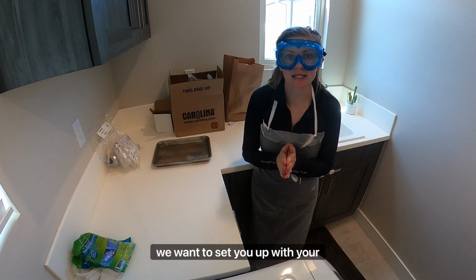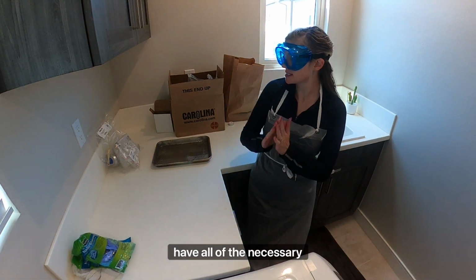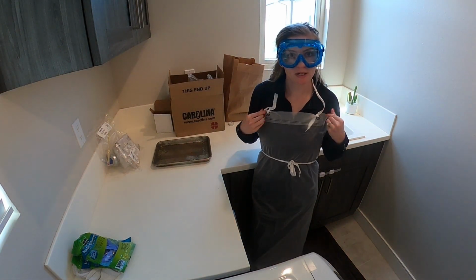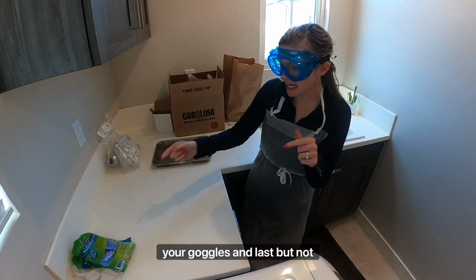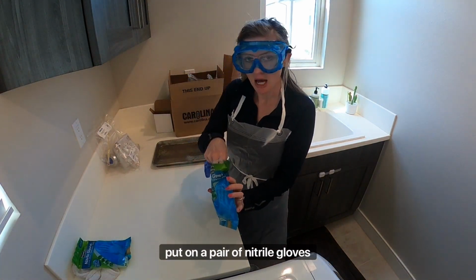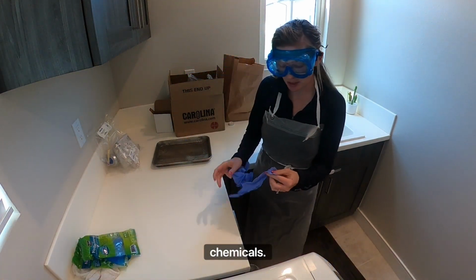As always, we want to set you up with your safety and make sure that you have all of the necessary materials. So first off, make sure you're wearing your apron, your goggles, and last but not least, you want to make sure that you put on a pair of nitrile gloves before we start handling any chemicals.